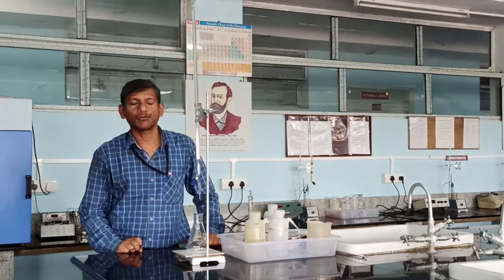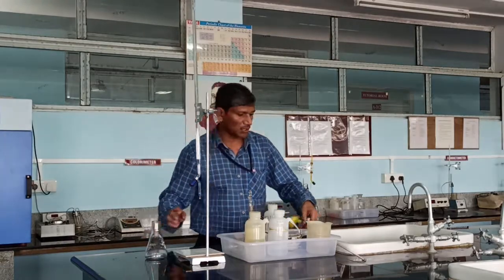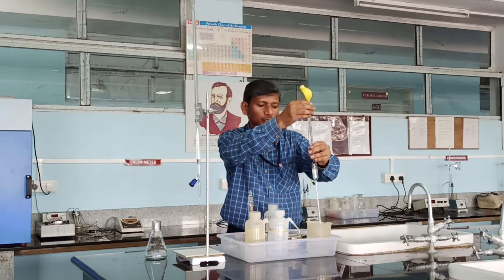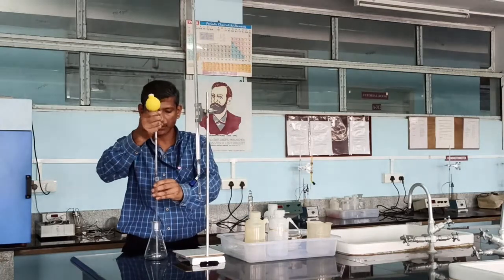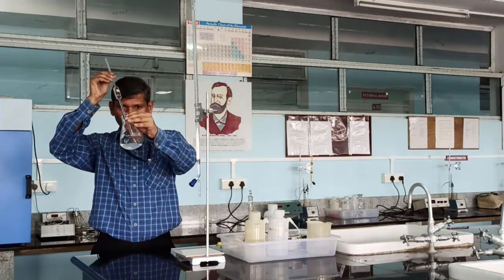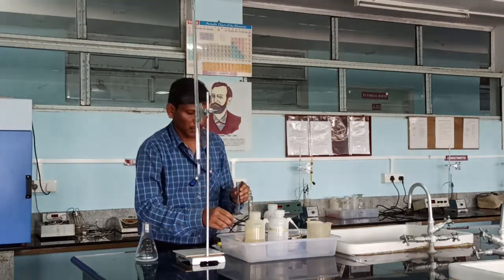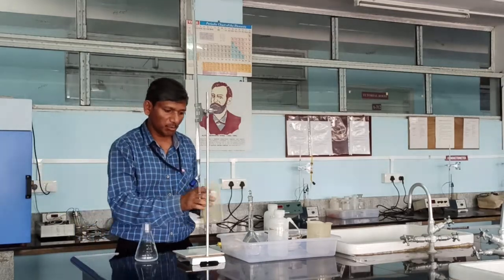The second part is estimation of total hardness of water. Pipette out 25 ml of the water sample into a conical flask. Before pipetting, rinse the pipette with the water sample. Only these two pieces of apparatus — burette and pipette — need to be rinsed with their respective solutions. Then add 5 ml of buffer solution. The buffer solution used is ammonia–ammonium chloride buffer.